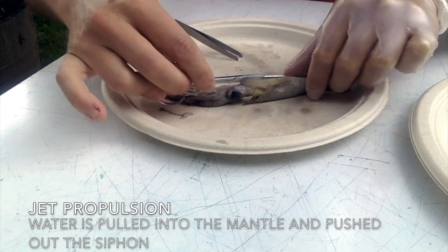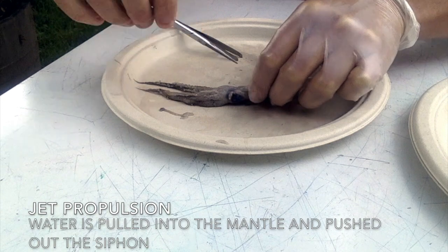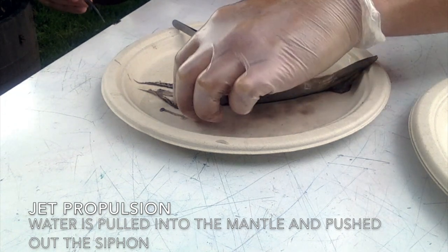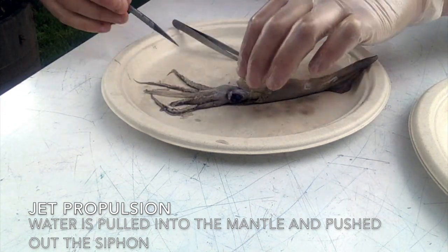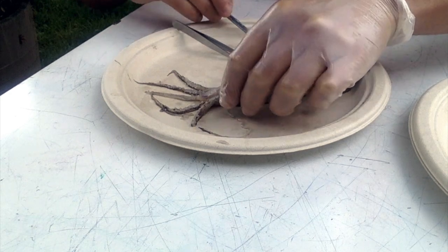And the siphon's also like a hollow tube. So these are all muscular structures. It pulls water into the mantle and then shoots it out the siphon this way, and then it can do jet propulsion through the water. It makes it swim super fast. It's one of the fastest swimmers in the ocean. Some species of squid are considered the fastest invertebrates in the world.